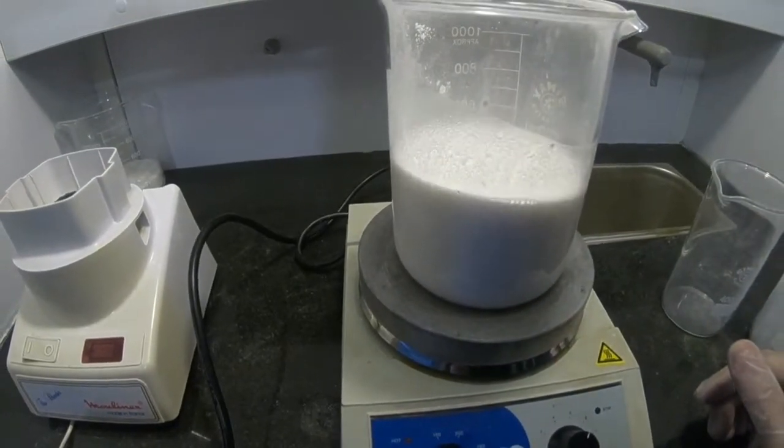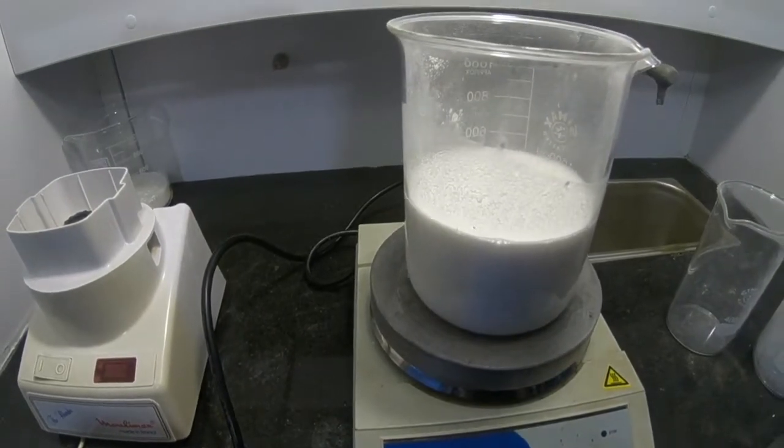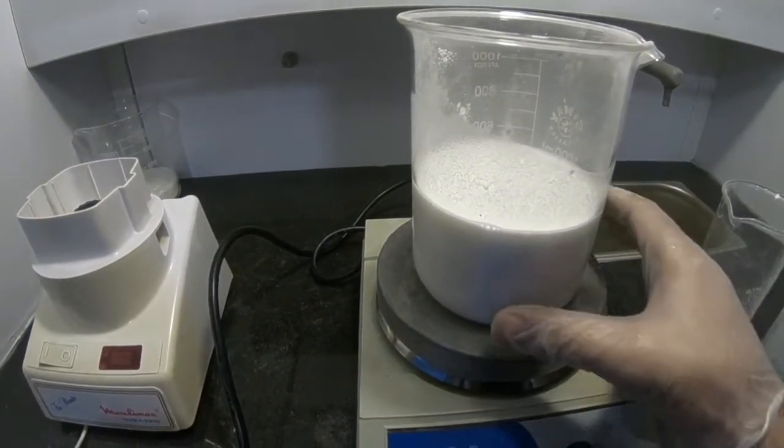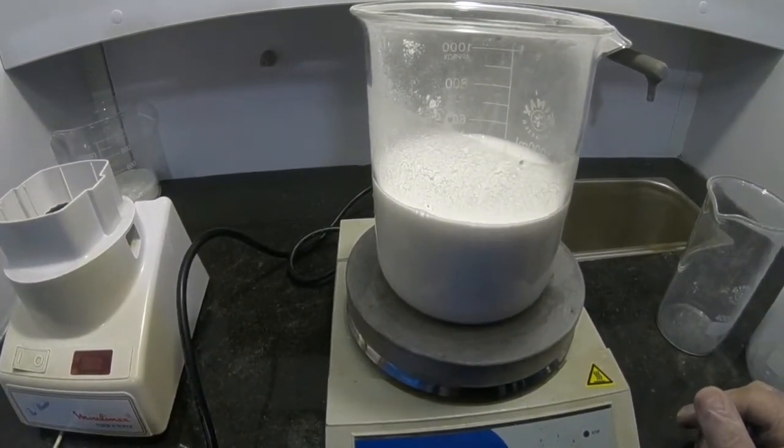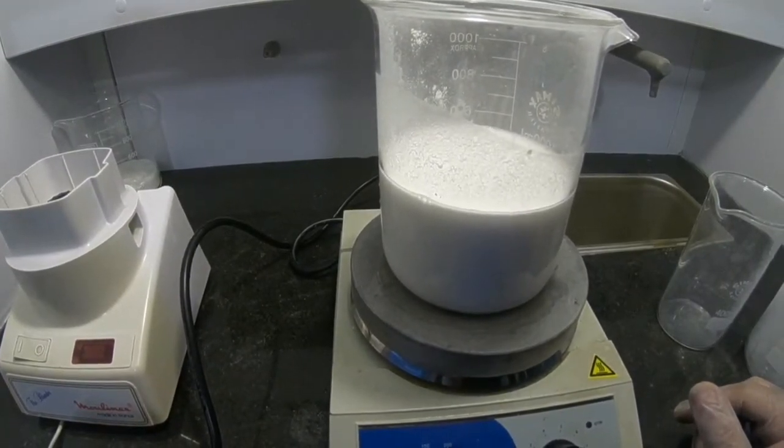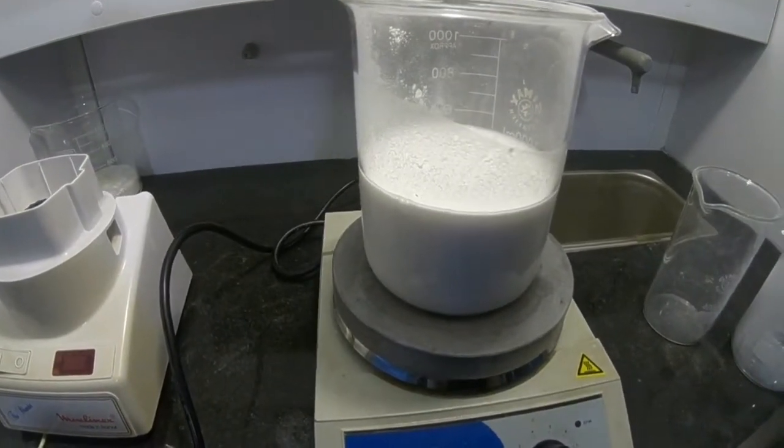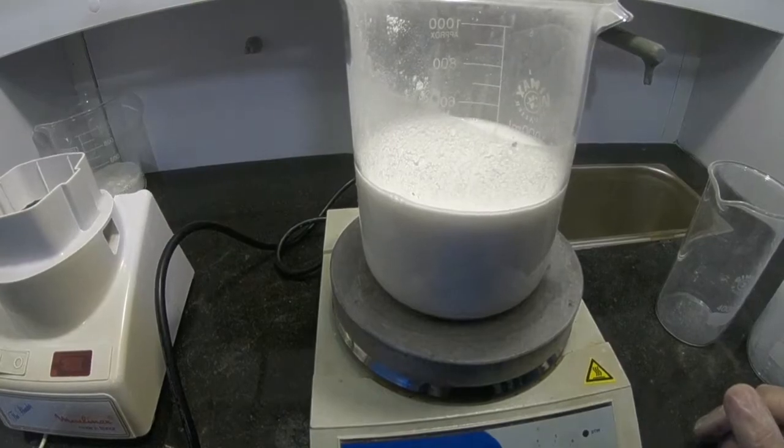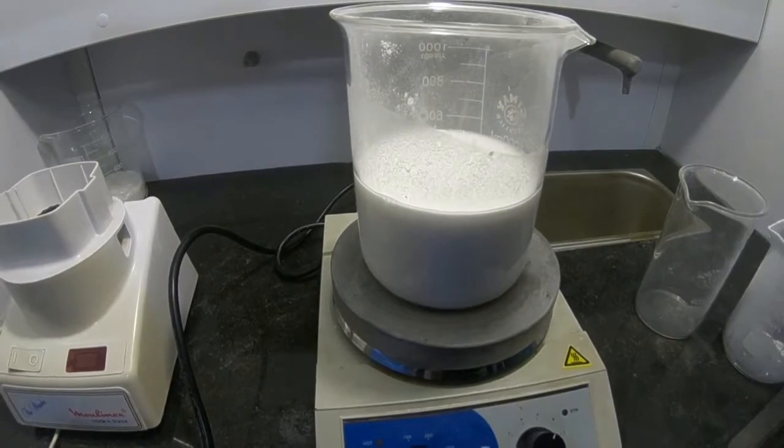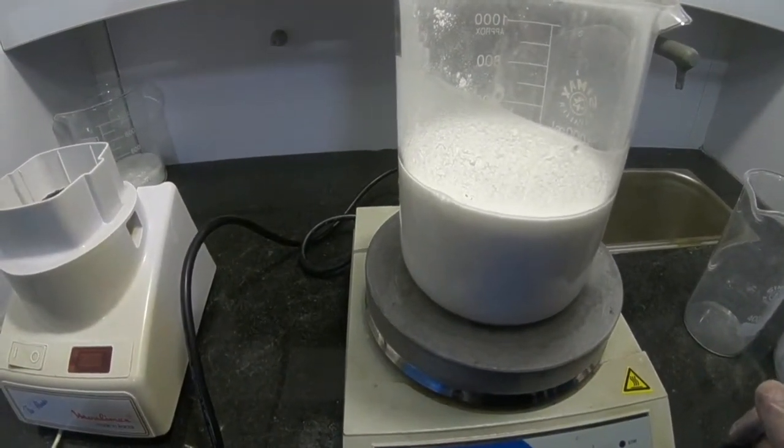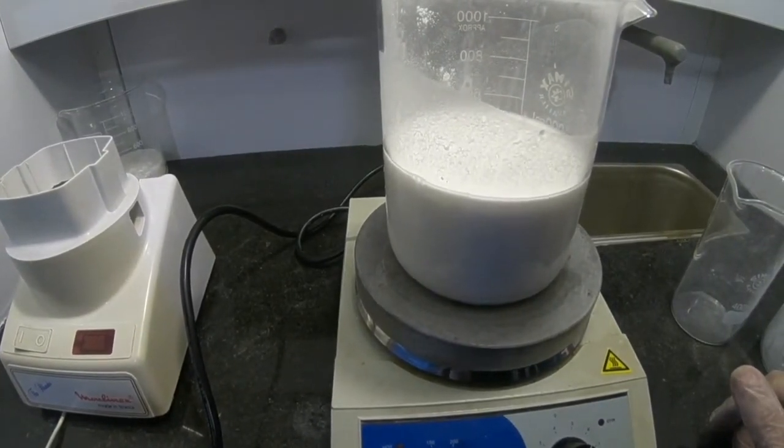But first we have to remove all the fillers and other stuff. For that, we are leaving it to stir. Most of the carbamazepine will dissolve in methanol, then we are going to filter it, and then we are going to concentrate the solution under vacuum at room temperature.